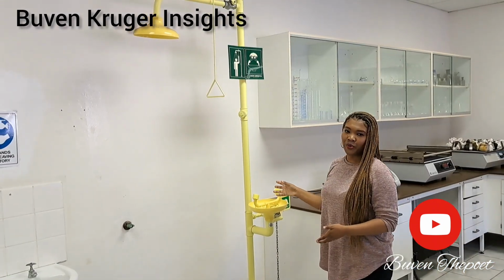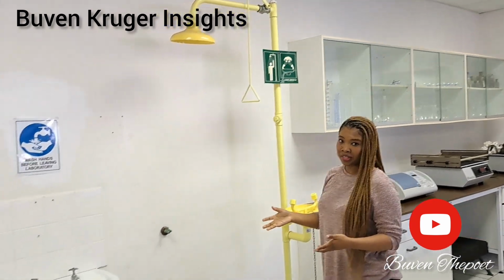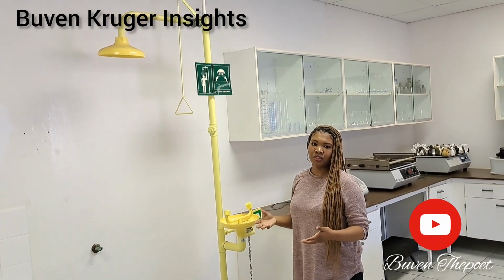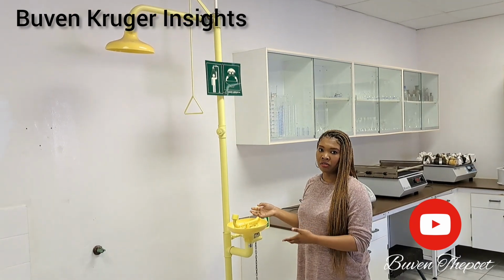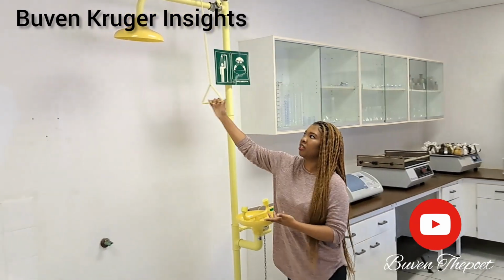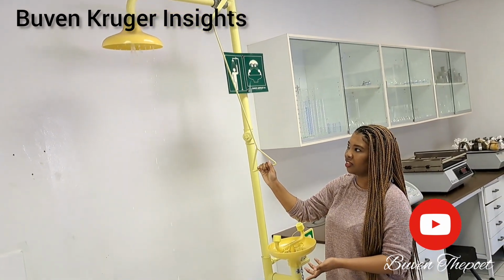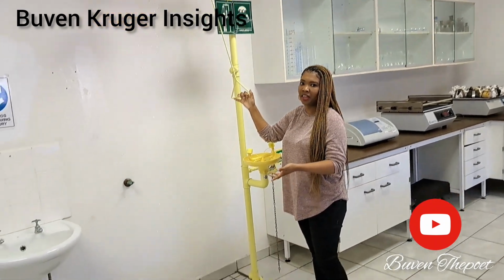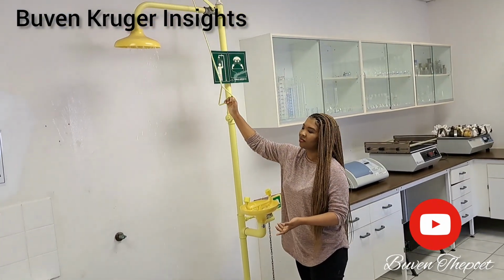So this is what we call an emergency shower, accompanied by an emergency basin. What this is used for is if you get chemicals on you, especially hazardous chemicals, you can quickly wash it off using this emergency shower. All you do is put it up here, get under here, and just wash it off. This is normal water, no chemical in it. And then you're good to go.